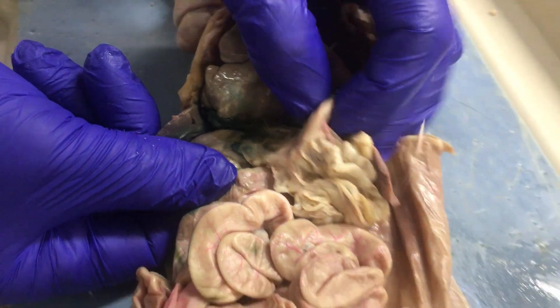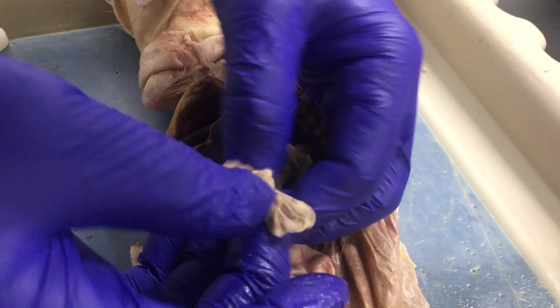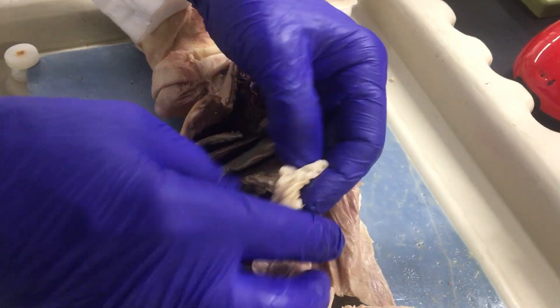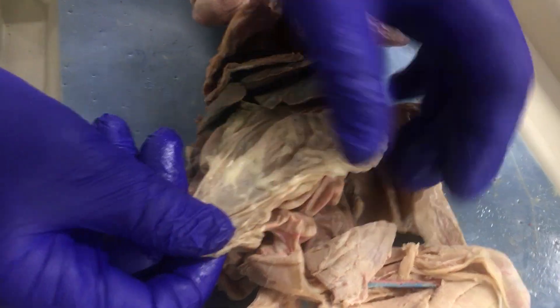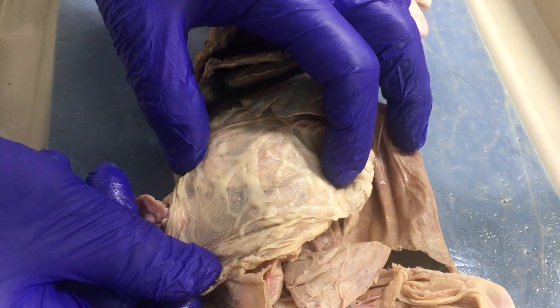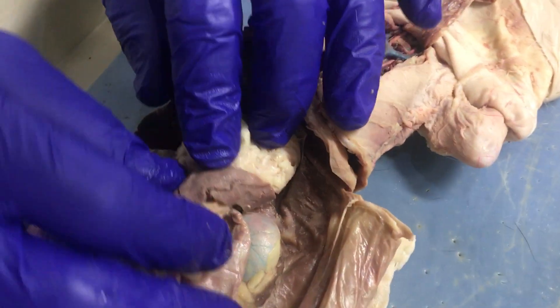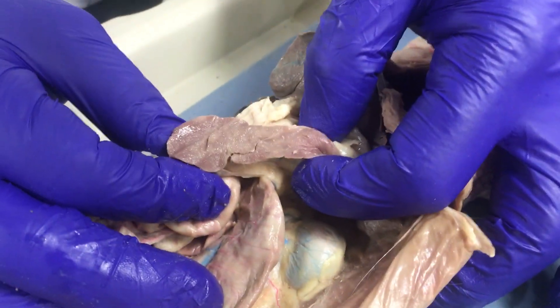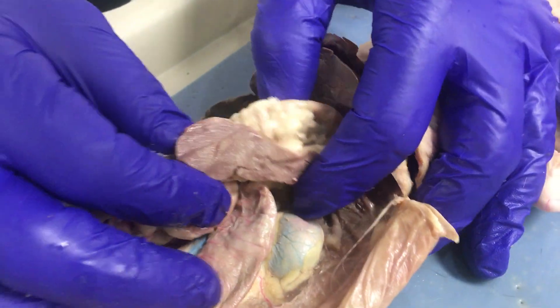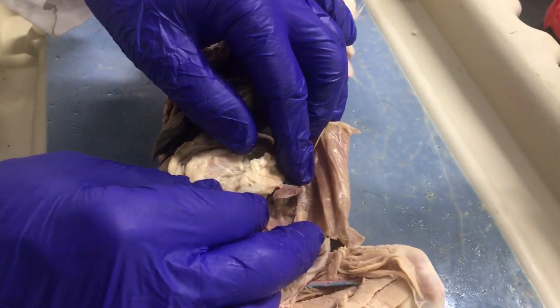On the greater curvature of the stomach is this big apron of fat, which is known as the greater omentum. It's like a blanket covering the intestinal area. And attached to the side of that is this long tongue-like organ, which is the cat's spleen. The spleen normally lays right behind the stomach.